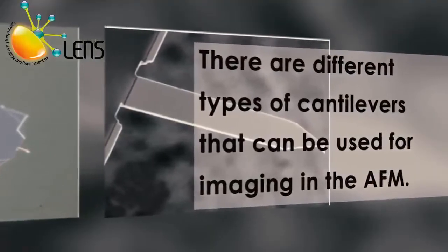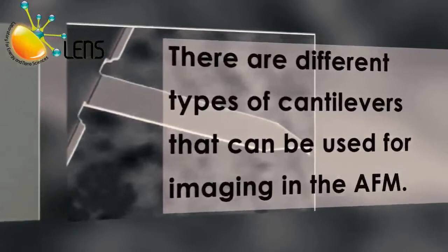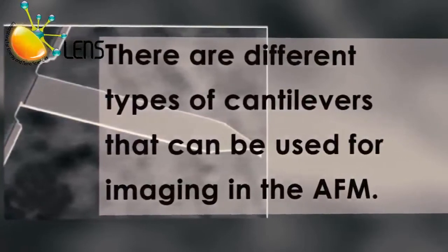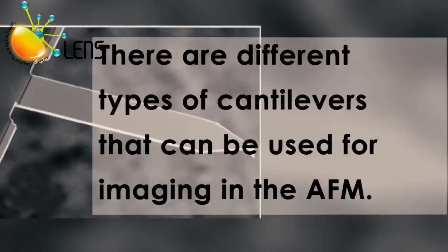There are different types of cantilevers used for imaging in the AFM. Selecting a cantilever will depend on the nature of your experiment. For example, in the Lens group, most of our cantilevers are silicon cantilevers, such as Olympus AC160 and AC240.